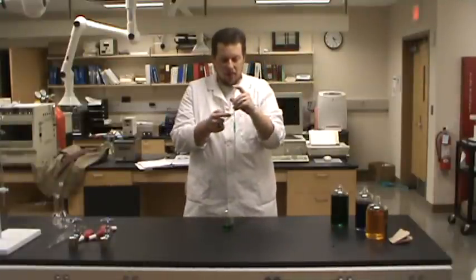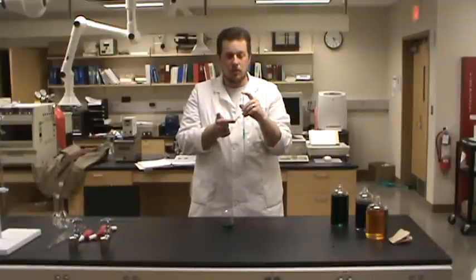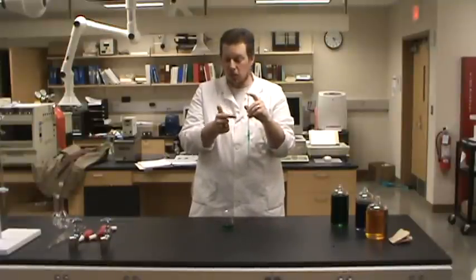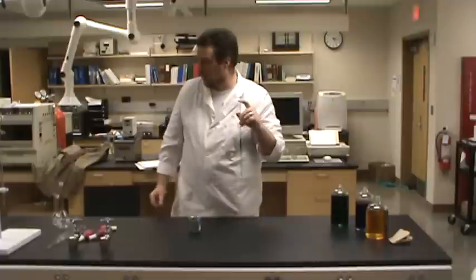Now what about this pipette? This does not contain 5 milliliters because what? This is calibrated to deliver 5 milliliters. So let's find something to deliver it into. I've got an Erlenmeyer flask here.